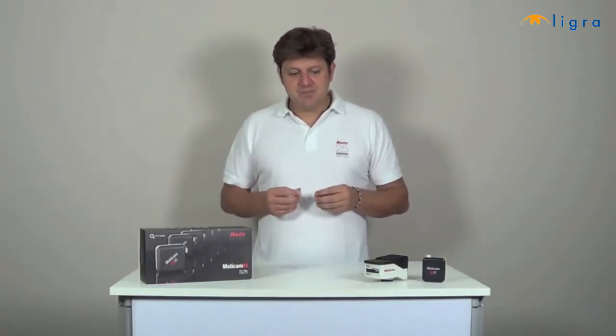The idea of this video is to give you a good basic knowledge about the different models of Moticam cameras, their use and the way to connect them onto the microscope. In the first part of the video I will talk about the Moticam CMOS cameras and the differences between several models, going from standard resolution cameras to optimal performance cameras, documentation cameras, Wi-Fi cameras and high definition cameras. All of these models have their specific characteristics and fields of applications.